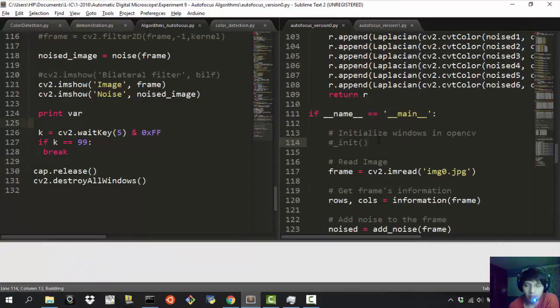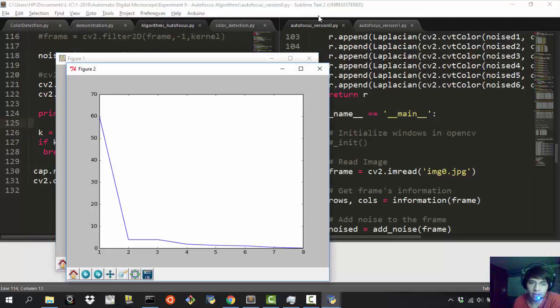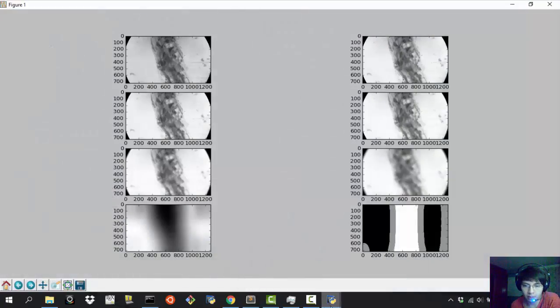Okay, so as I was saying, the energy of the Laplace seems to give the best results because of the variability that you have between the highest value in the curve and the lowest value of the curve. So I like that very much, because I can have a very differentiated approximation, and so it's best for my results, as you will see. And it's easier to compute this kind of stuff. I don't like being stuck at a local maximum, so this is going to fit very well to my purpose.